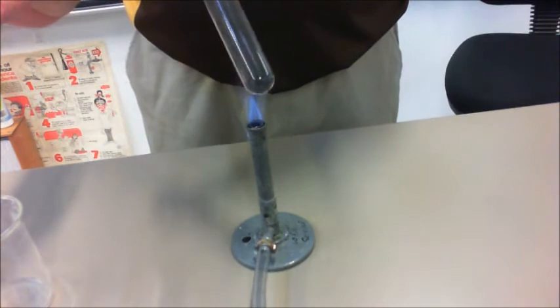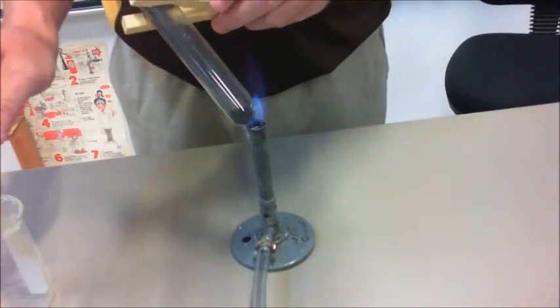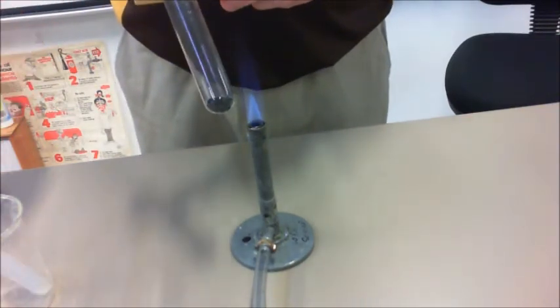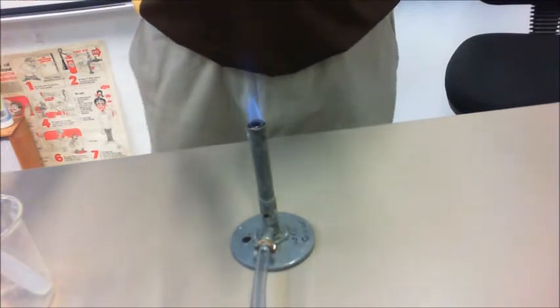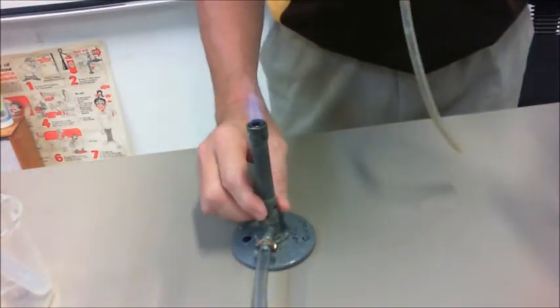Now, what we need to do is, for safety reasons, we need to take away the delivery tube first, and then we can take off the copper carbonate.